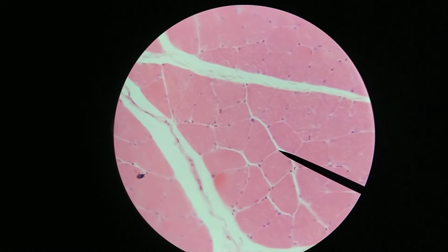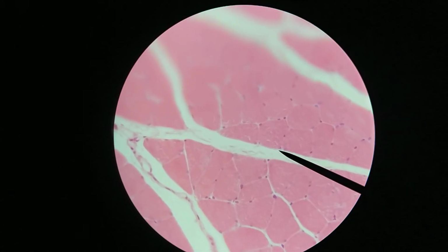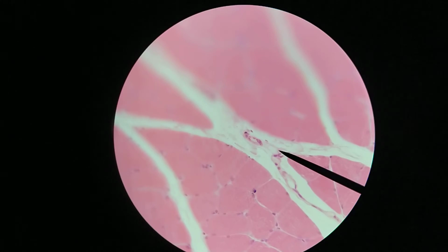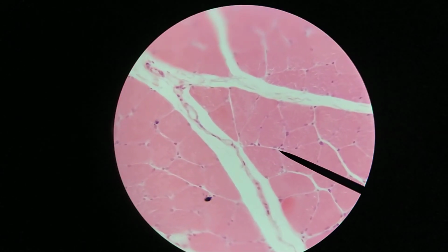Now again, this material that is in between the cells, the clear spaces around the individual cells, that's where you'd find the endomysium. So each cell is surrounded by an endomysium, and then around here, where we have a space between two fascicles, so here's one fascicle, here's the other fascicle, this space here would contain the perimysium. You can see some of the blood vessels in this perimysium right here. Arterioles, small arteries would be in here, and then capillaries would be down within the endomysium.